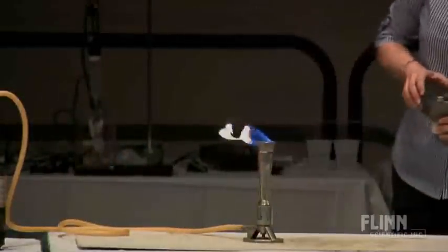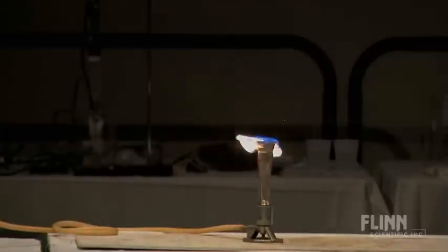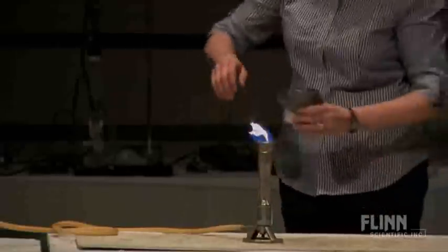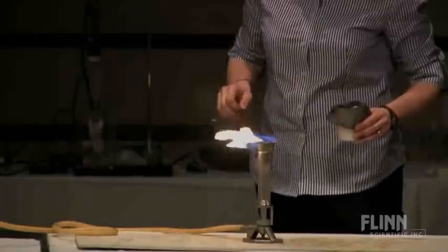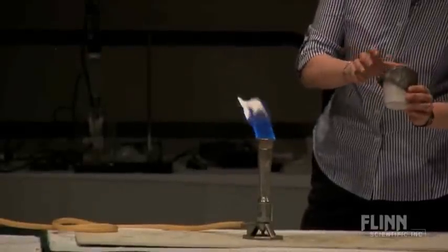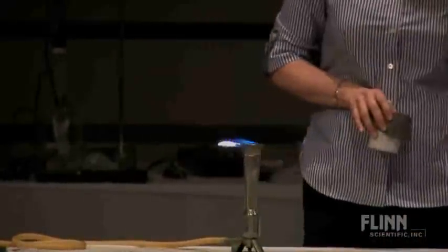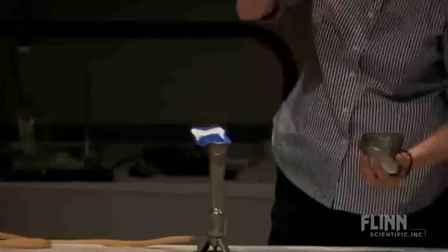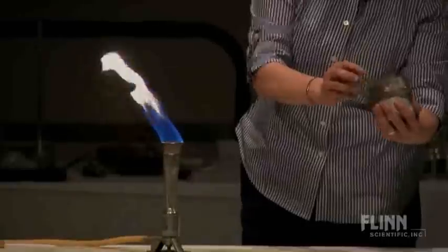Bring the lights down a little bit — there's a nice breeze in here sending the flames this direction. In the summer of 1999, I was lucky enough to go to a fireworks camp — that's right, firework school for a pyromaniac. That was awesome. I learned a lot of stuff; I probably kept both arms and most of an eye because of that. Now I've got some metals up here. I intended to bring five but brought three today — no aluminum, no zinc, since I didn't think they'd work quite like I wanted for this demonstration. So I've got a little bit of iron here, and if we can dim the lights down, we might have a little mood music for this.